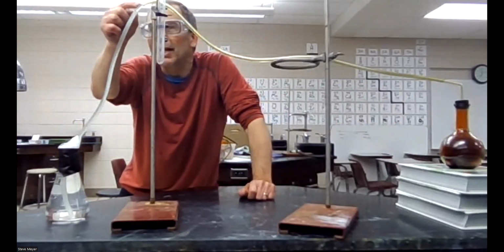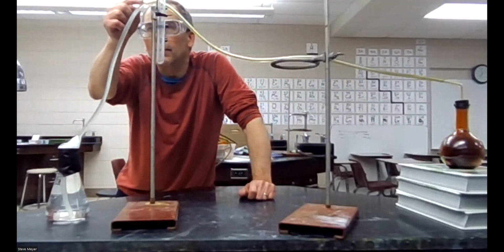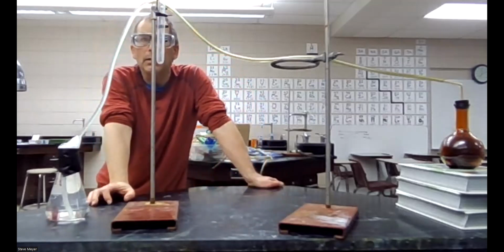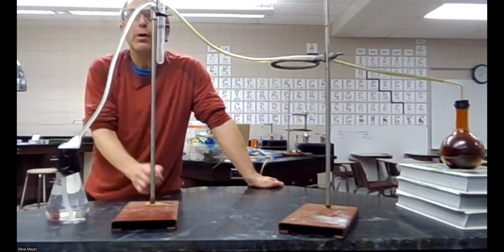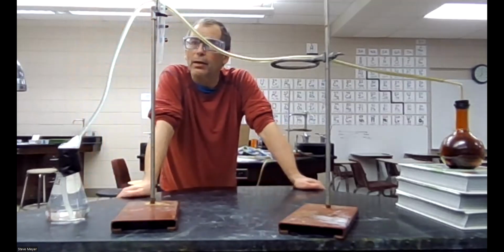Now, what's going to happen when it hits the top? We will see. Okay, so I think we're about 30 seconds and counting. 29, 28, 27, 26, and probably less time than that. It's right up here right now. And we'll watch this whole thing because we're still looking for our copper nitrate. Where is that in our system? Where did the copper penny go?